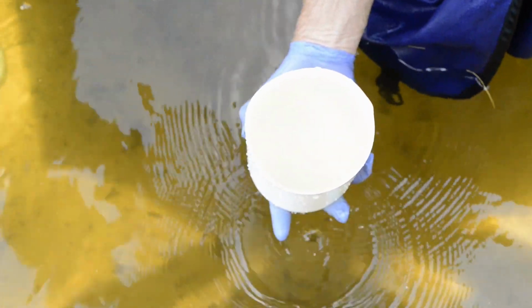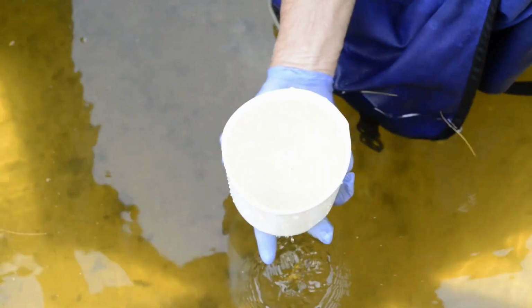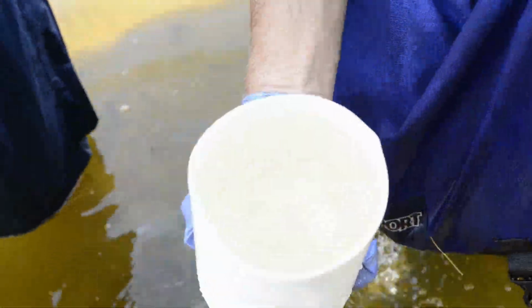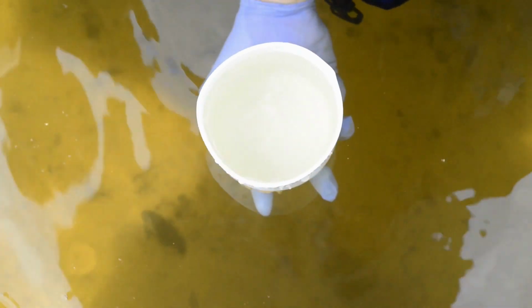So that's the whole idea with clean sampling, is to make sure you're not picking up extraneous stuff at the top, and also that we're not picking sand up on the bottom as we walk. You can see there's your shadow. So if you're not careful, if we go down and take a sample of this, we end up getting that sand. It may not show now, but you can actually see bits of that sand. As that settles down, you can see that settling.